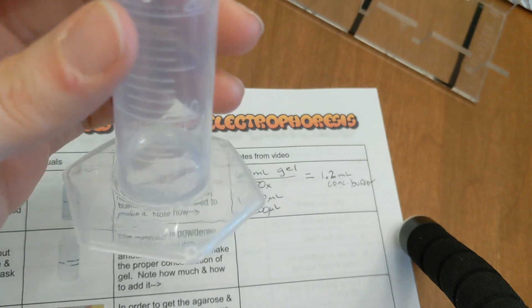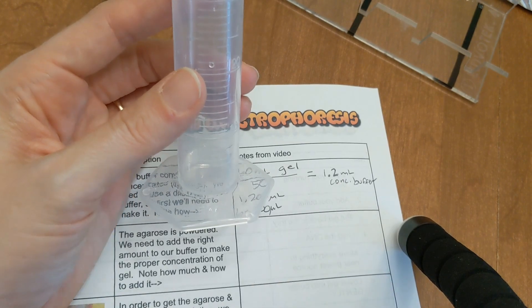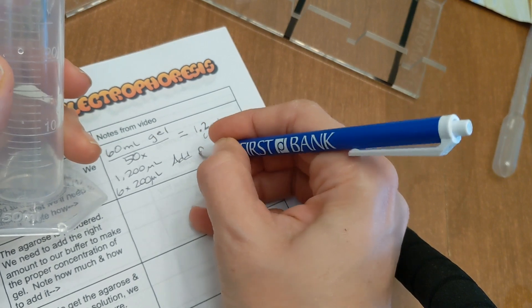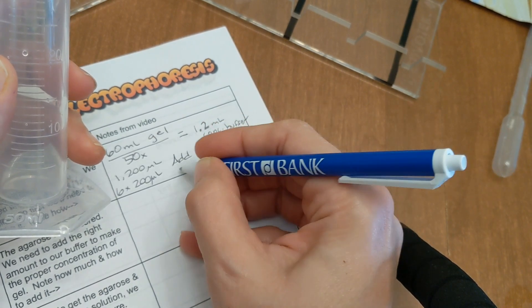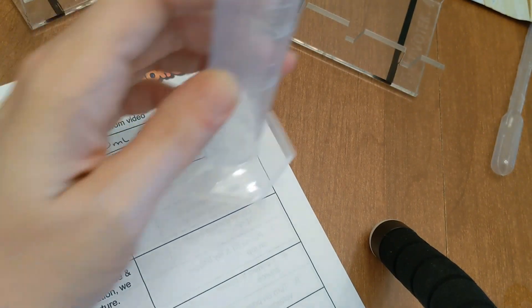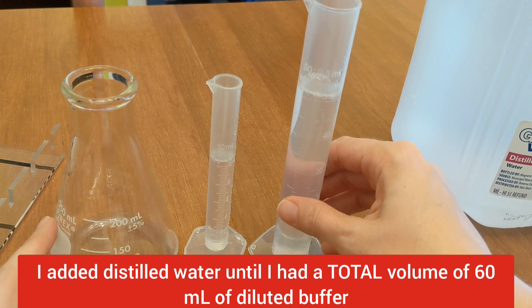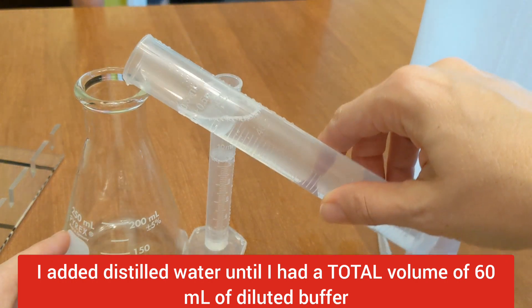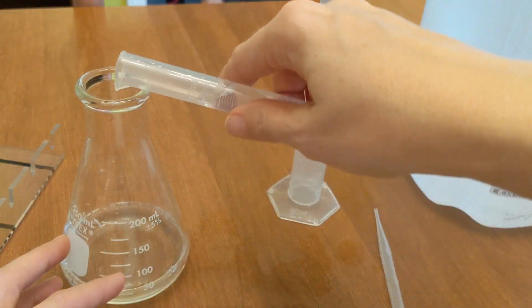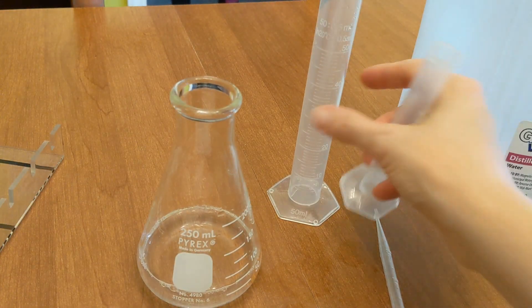You should see the buffer has filled the bottom of your cylinder to about a milliliter in height, slightly more. Now add distilled water until you reach 60 milliliters total. Since I don't have a 100 milliliter graduated cylinder, I did 50 in one and my last 10 milliliters of water in a smaller cylinder. Now I've mixed my concentrated buffer with distilled water and I have my 1x buffer.